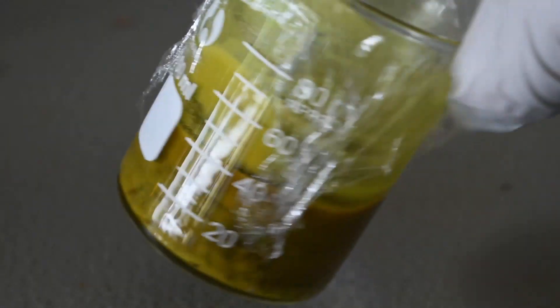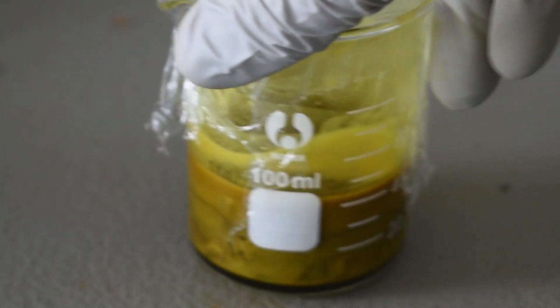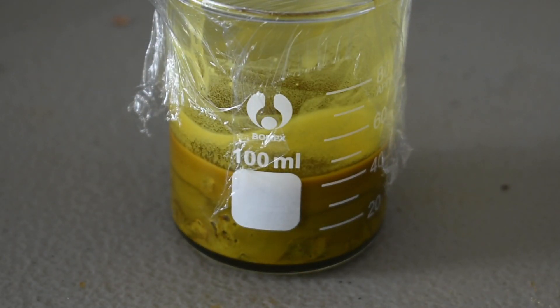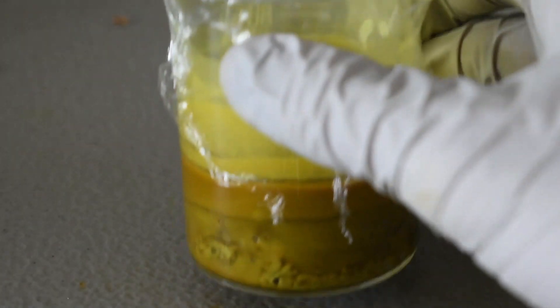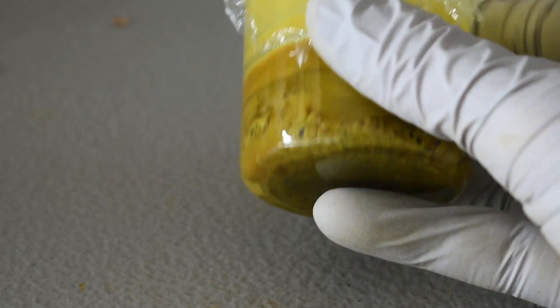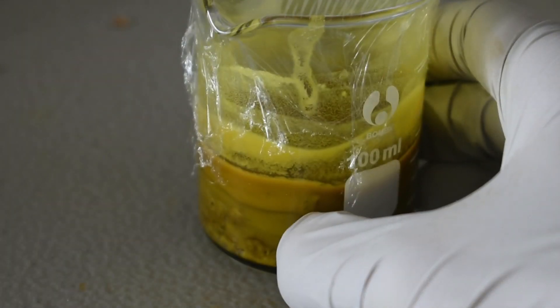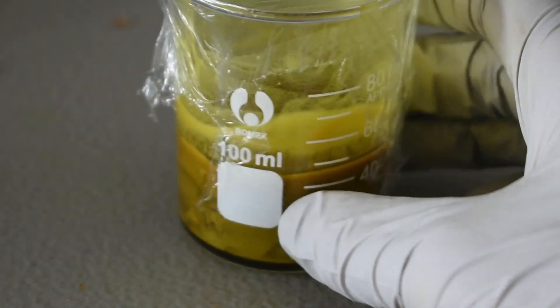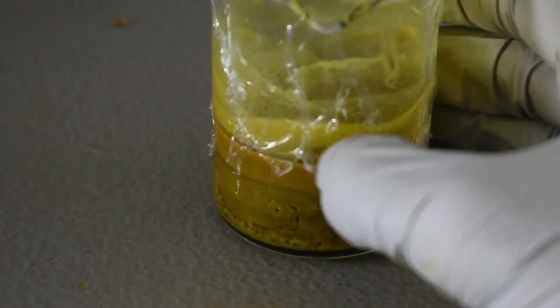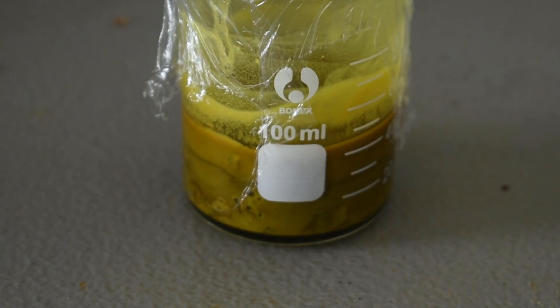And it's all been more or less absorbed as well. So I'm going to leave this here for a little bit. And we will see what the final result looks like. And then I'll have to scoop out this horribly smelling mess and put it into a vial. But the color, aside from being yellow, is very nice.